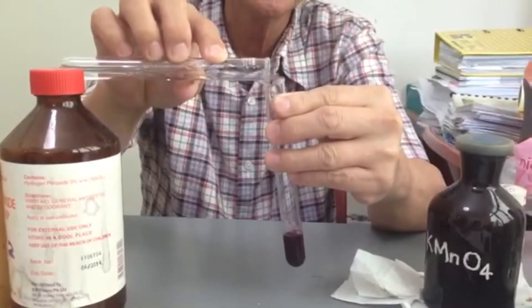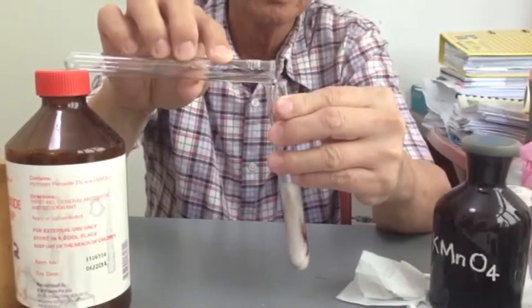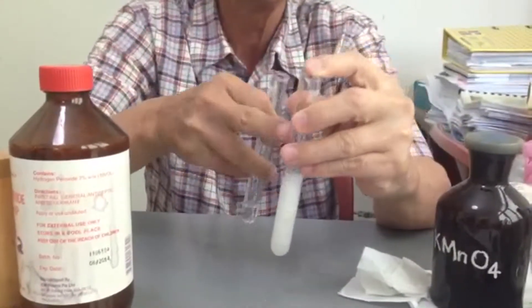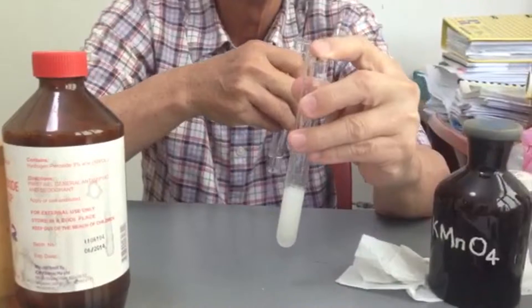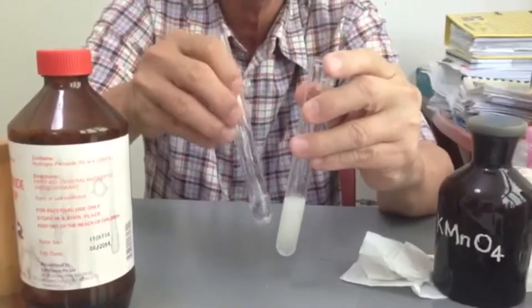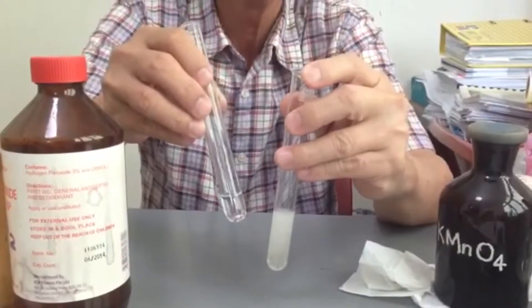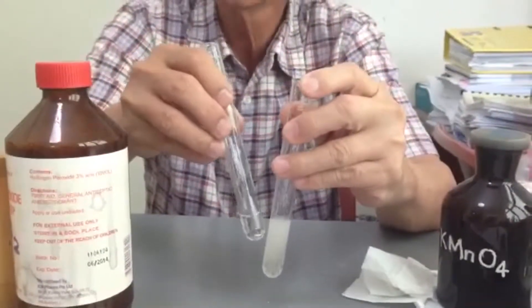Hydrogen peroxide goes in. Can you see? Oxygen is also evolved. The colorless solution now contains Mn²⁺.